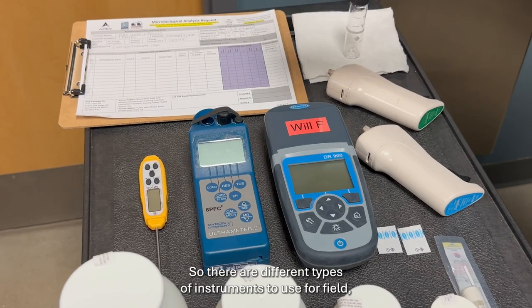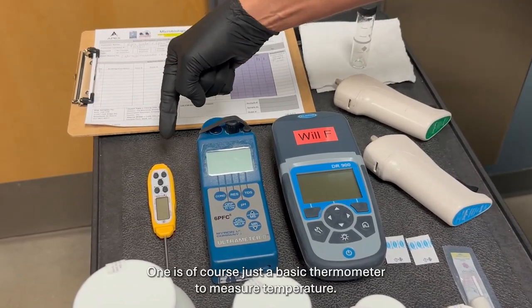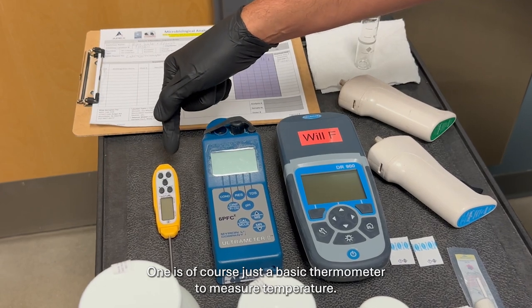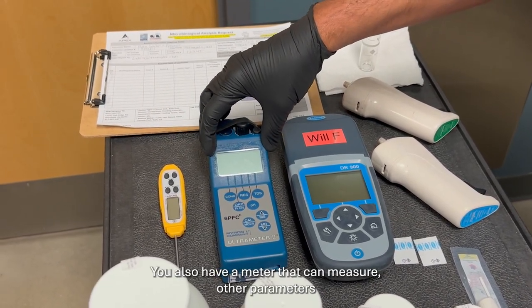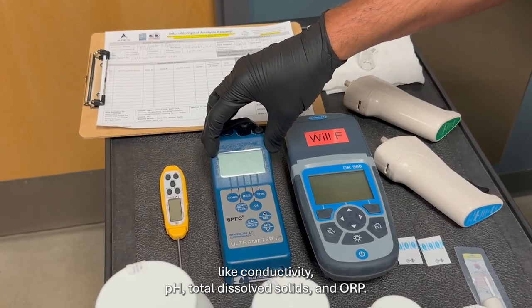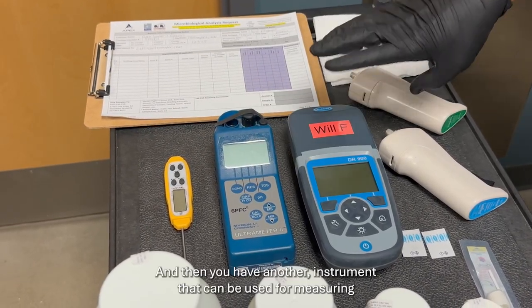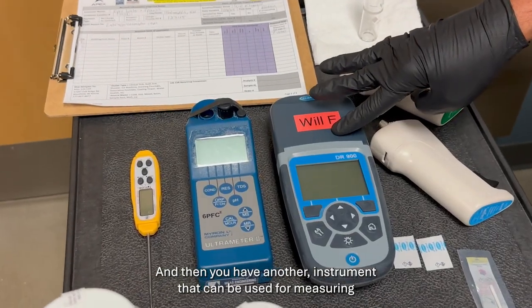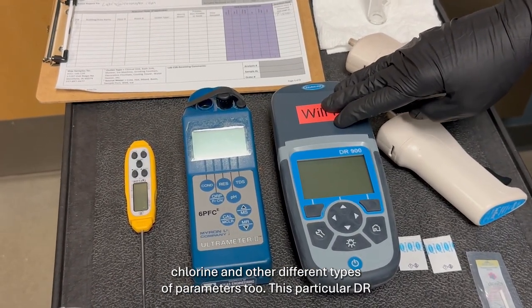So there are different types of instruments to use for field measurements. One is, of course, just a basic thermometer to measure temperature. You also have a meter that can measure other parameters like conductivity, pH, total dissolved solids, ORP. And then you have another instrument that can be used for measuring chlorine and other different types of parameters too.